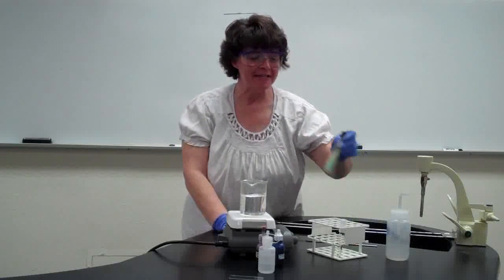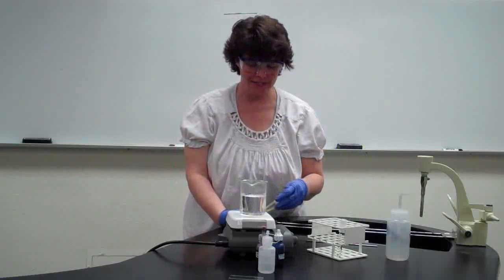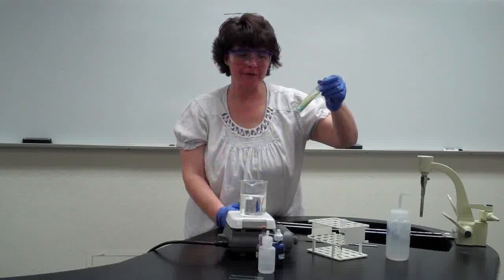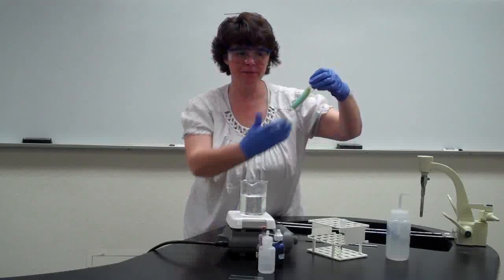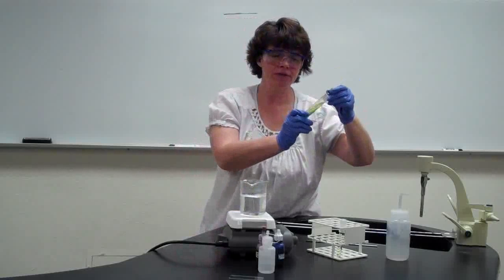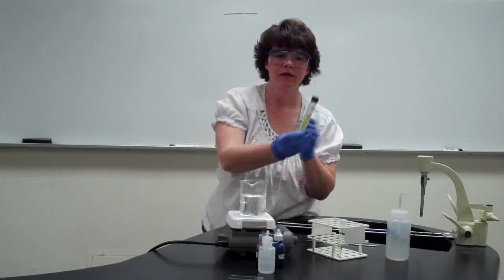Wow. If not, if they don't grow up, we have a backup plan. This is the way we've done it in the past. You would actually take the bacteria off of this slant here. You'll notice some differences. The media is a blue color. It's a special media just for Mycobacterium. You'll also notice the bacteria is kind of yellow in color, and you can actually see the chunkiness of it.